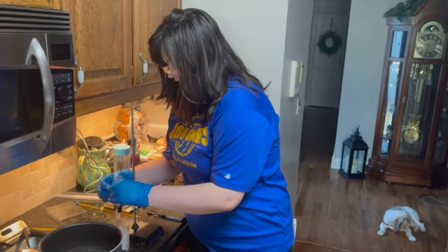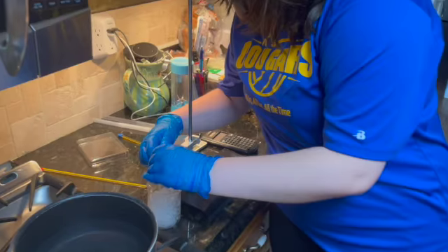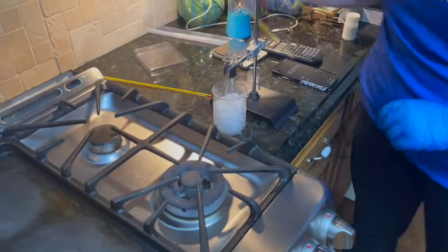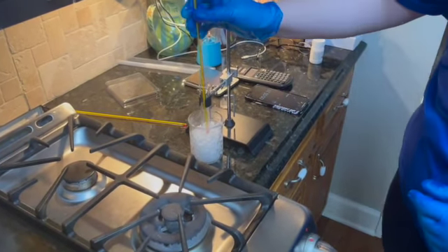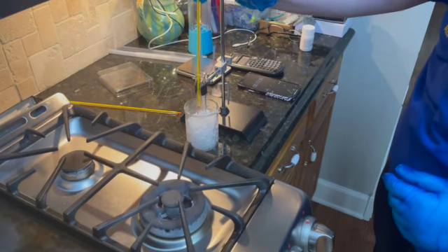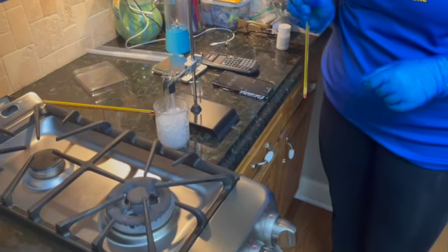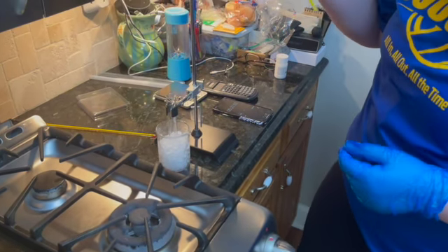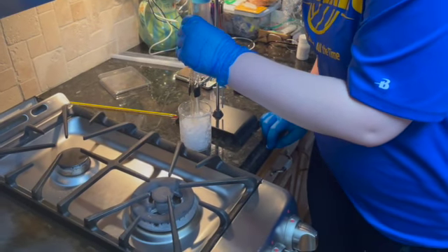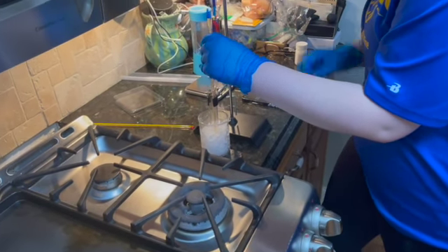Okay, so now I am putting our solvent into the ice bath and tightening the clamp to make sure that it stays in its place, and beginning our timer. So at the very beginning of this, it has gone down quite a bit. It is at 45 degrees Celsius right now. Okay, and looking at my thermometer, I can tell that it has gotten pretty solid. Not super quickly, it's kind of turned more into a gel than anything else, but this is at around 30 or so seconds.